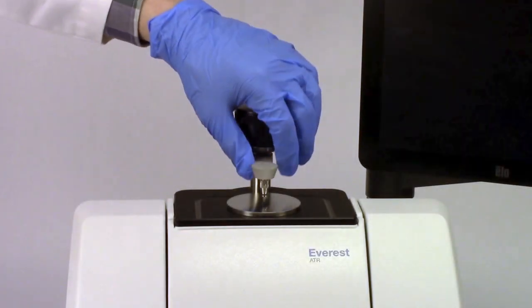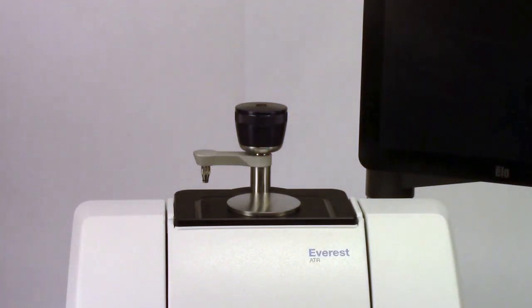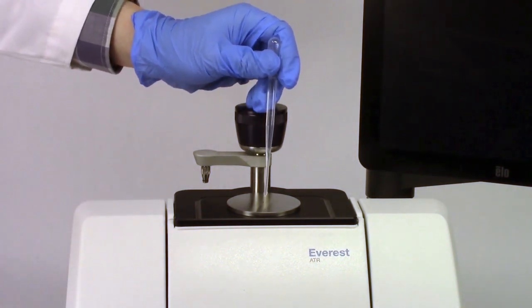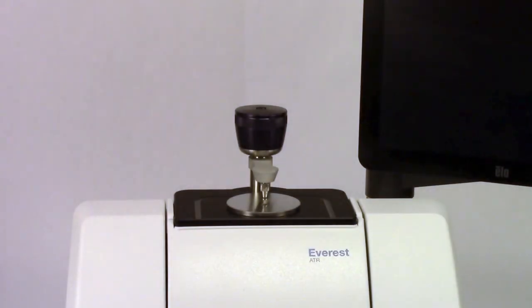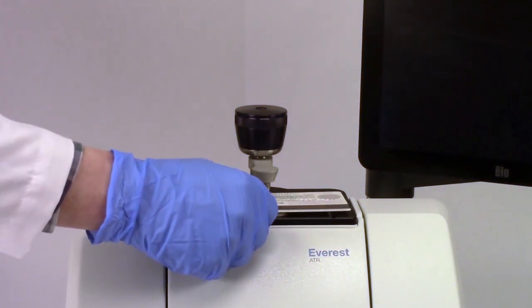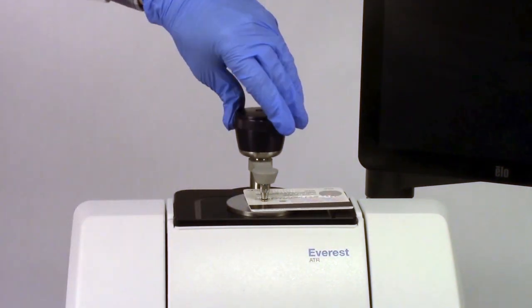If your sample is a liquid, rotate the pressure arm out of the way and use a clean pipette to place a single drop on the crystal. The sample should cover the crystal completely. For a solid sample, raise the arm, place the sample on the crystal, and then rotate the knob until it clicks.